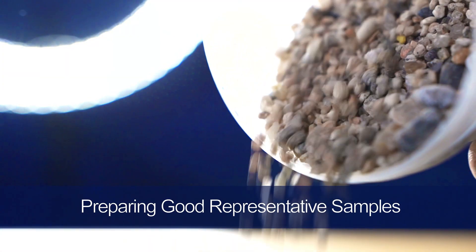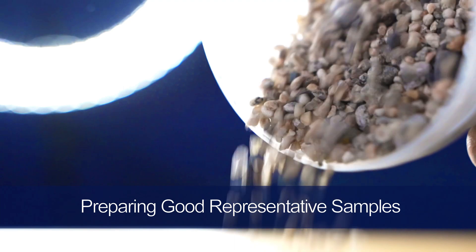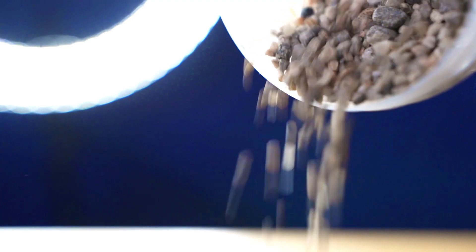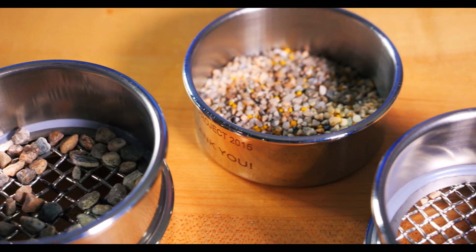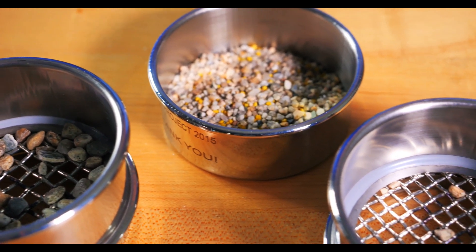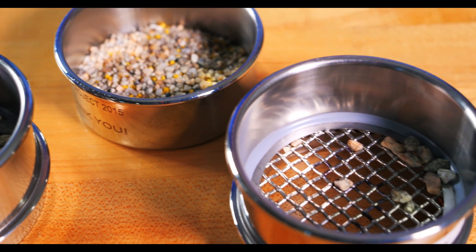Now that you have a general understanding of the many factors that can cause inconsistent results, you're probably curious as to what you can do to achieve the most accurate and repeatable results. The number one thing for getting good sieve results is taking a good representative sample of the material you're going to sieve. So be sure to evenly divide and accurately weigh each sample. If you drop or lose any material in between testing, you should gather enough material to make up for what was lost.